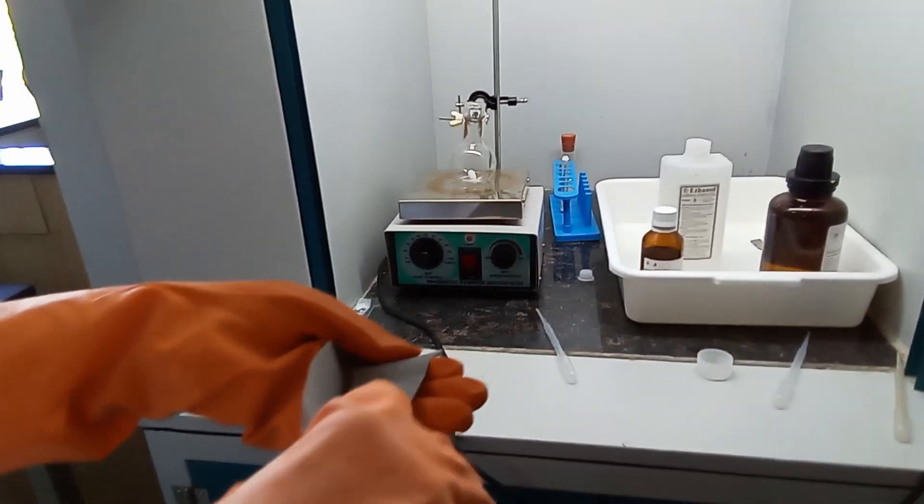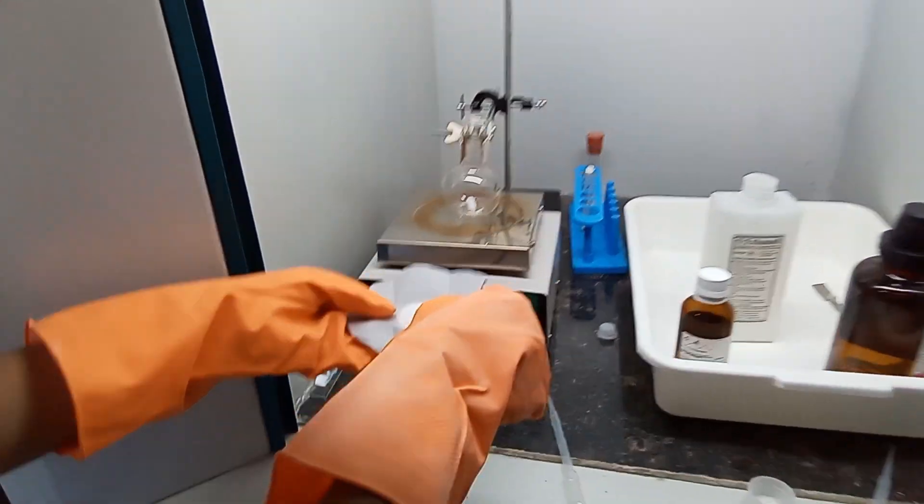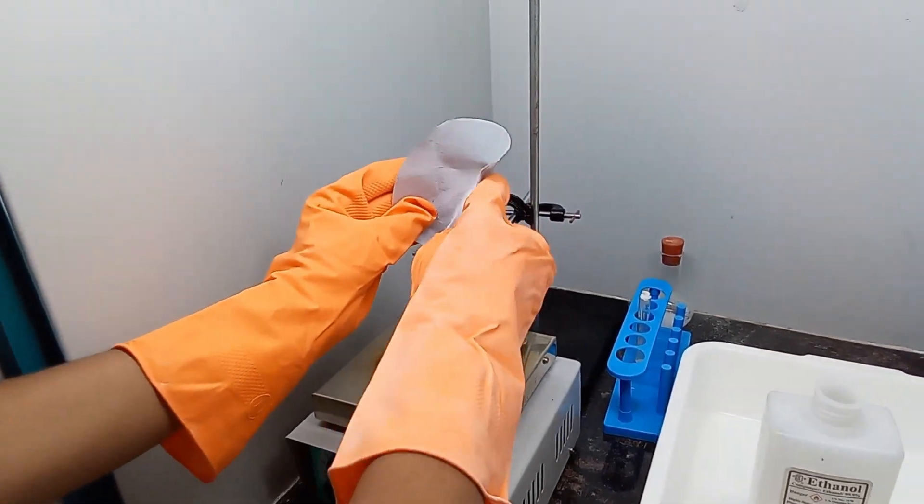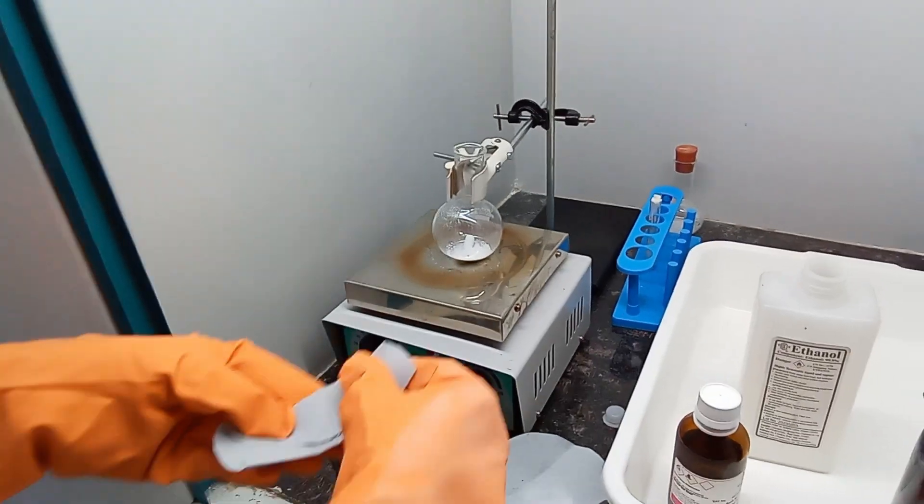Now, for the synthesis. Firstly, zinc acetate is added. Secondly, terephthalic acid is added.